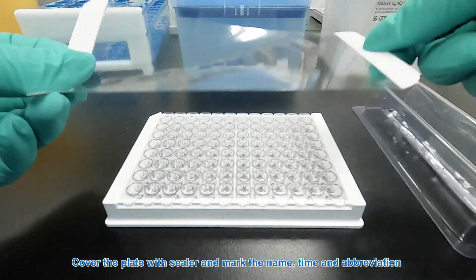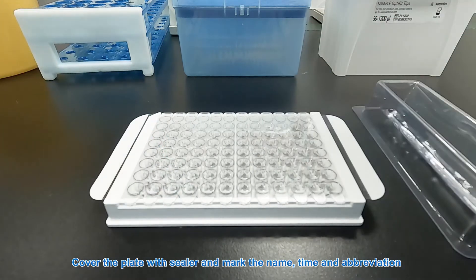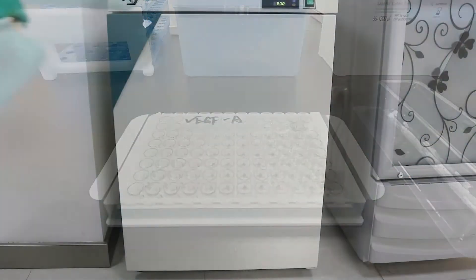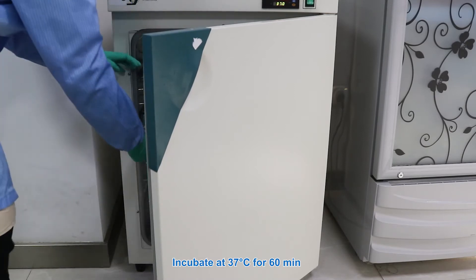Cover the plate with sealer and mark the name, time and abbreviation. Incubate at 37 Celsius degrees for 60 minutes.